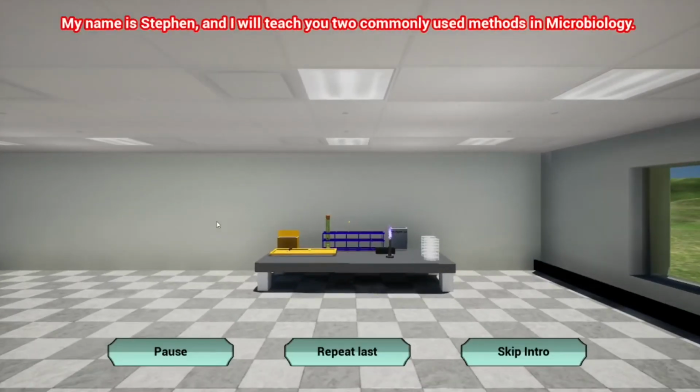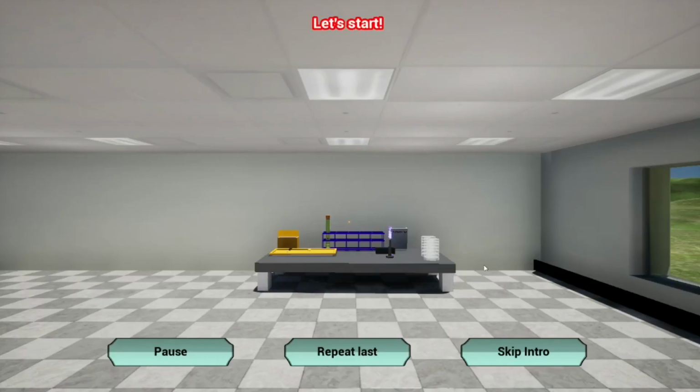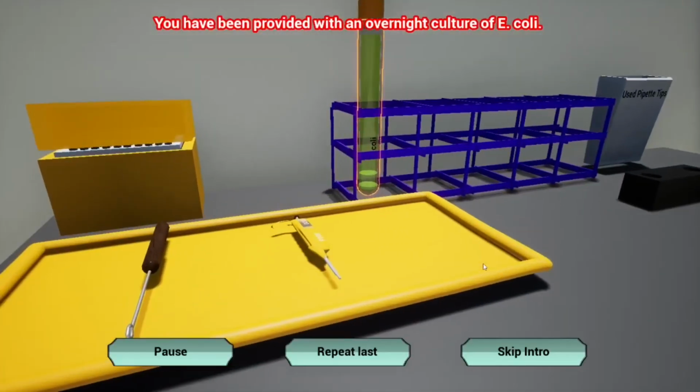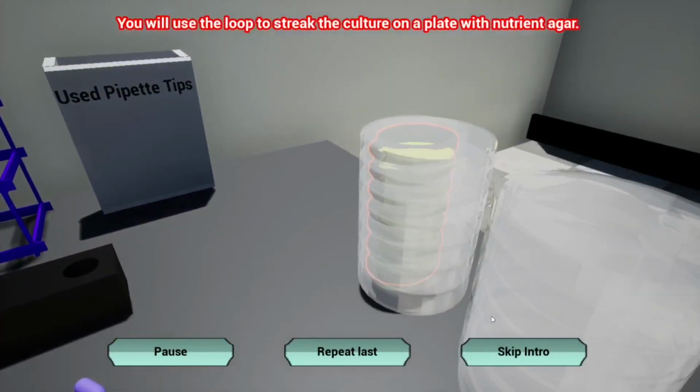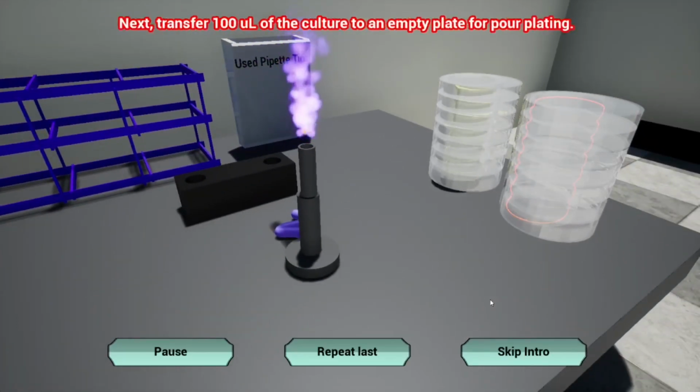My name is Stephen and I will teach you 2 commonly used methods in microbiology. In this lab we will learn streak plating and pour plating using aseptic techniques. Let's start. You have been provided with an overnight culture of E. coli. You will use the loop to streak the culture on a plate with nutrient agar. Make sure to flame the loop to sterilize it before using. Next, transfer 100 microliters of the culture to an empty plate for pour plating.